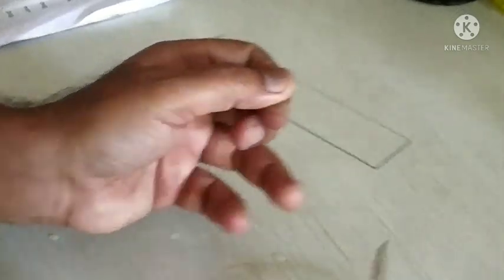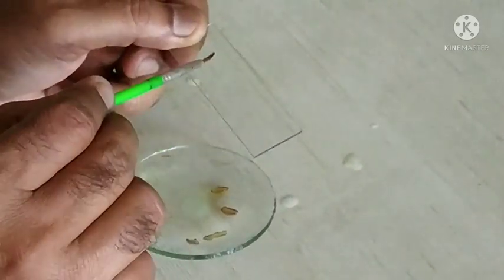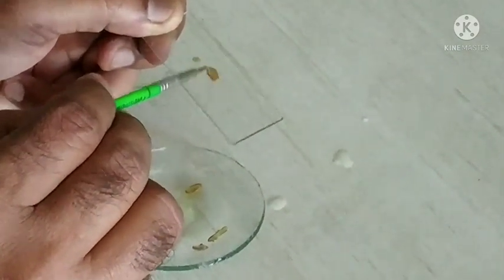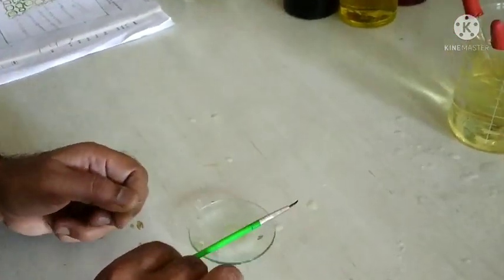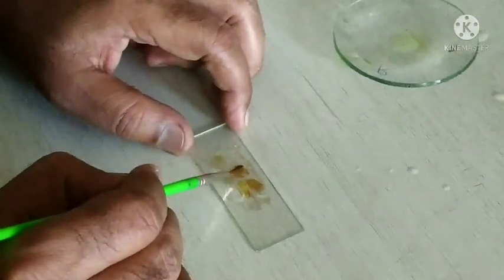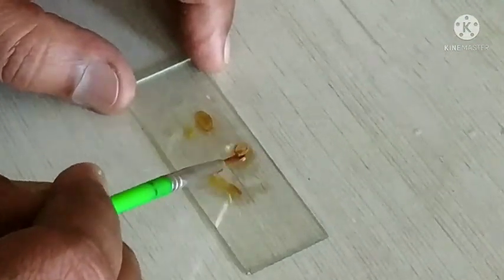After cleaning, transfer the sections onto a slide with the help of a camel hair brush slowly. Then place a drop of water and add a drop of glycerin as a mounting reagent, which prevents the dryness of the section. After proper mixing, place a cover slip with the help of a dissecting needle on the section.